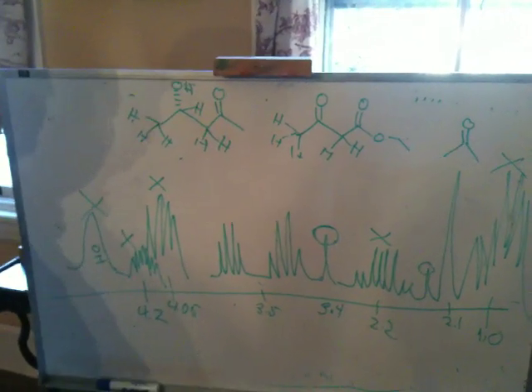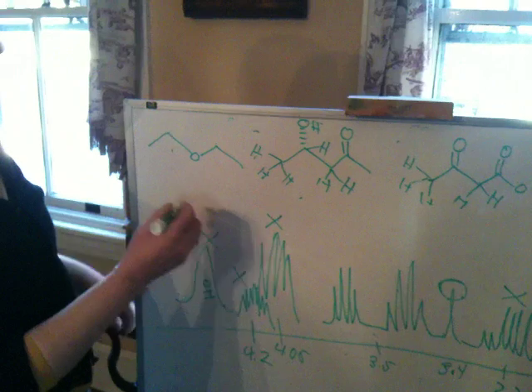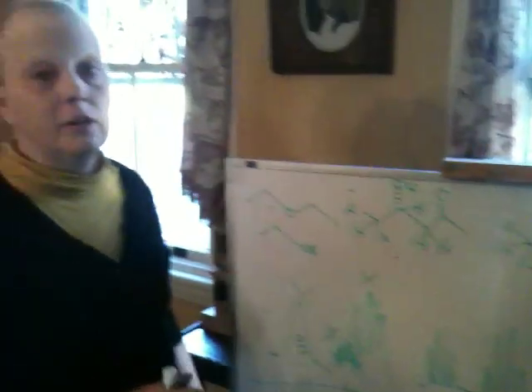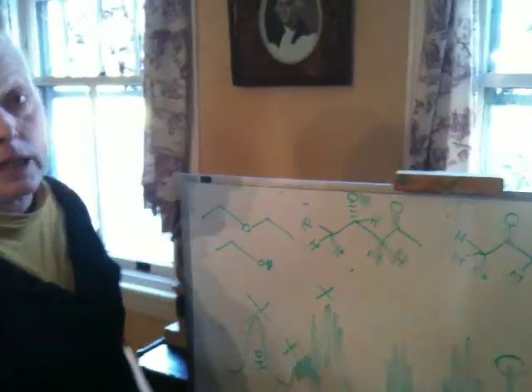I'm leaving that to you. I'm assuming that people have diethyl ether in their sample and they have ethanol in their sample. But I think the only way you're going to figure this out is by really looking up the spectra of those and seeing if there's any correlation here.